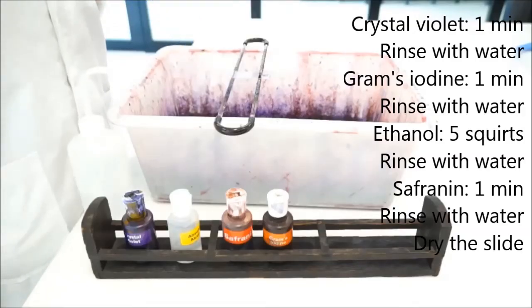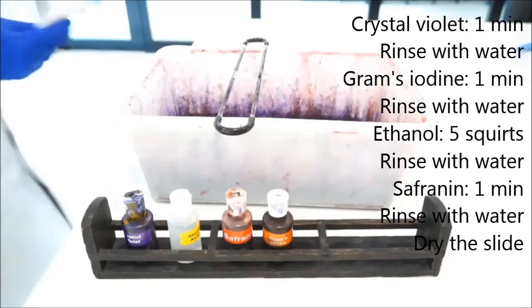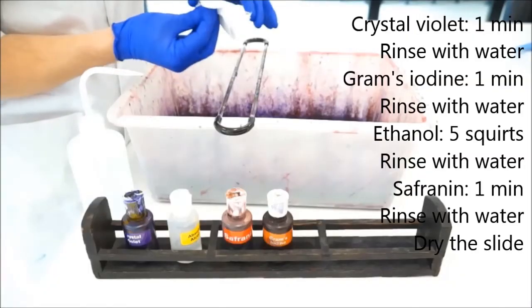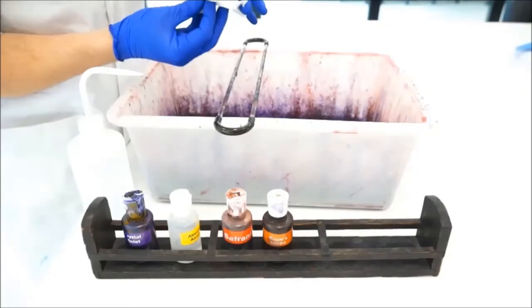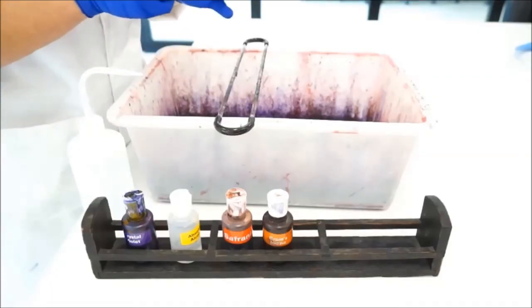Once you've completed that, you should get a little bit of paper and dry the bottom of the slide because you'll want to be putting this onto a microscope for viewing. And so get the slide and just wipe the bottom so it's nice and dry. You can also pat the top dry, but don't wipe that, otherwise you'll wipe the bacteria off.